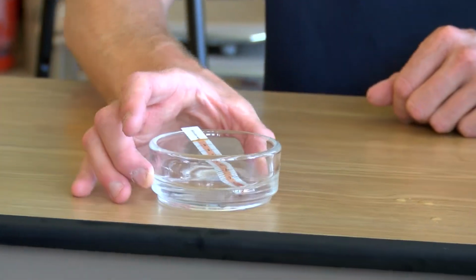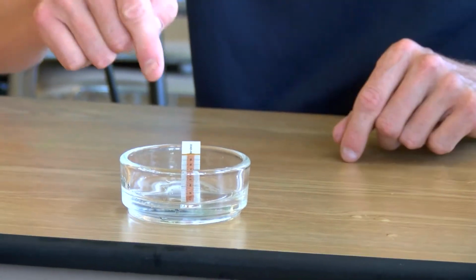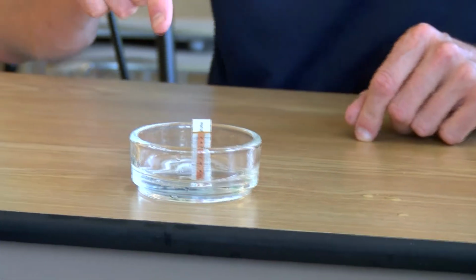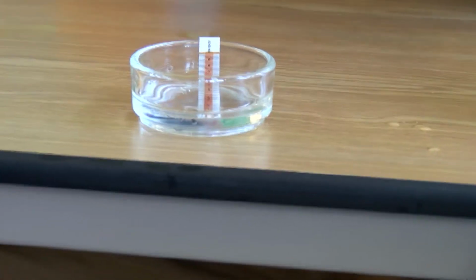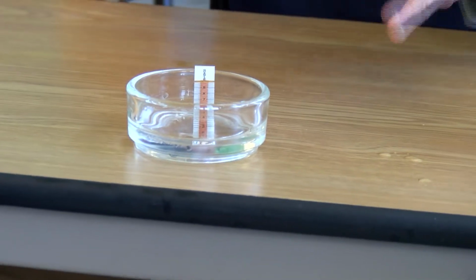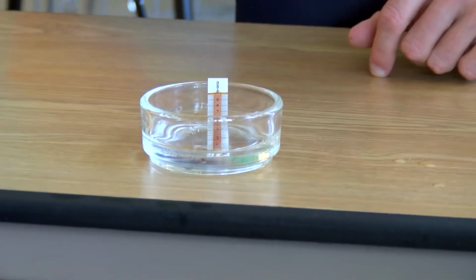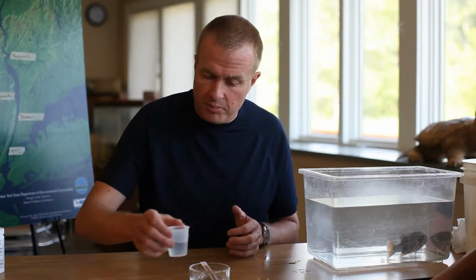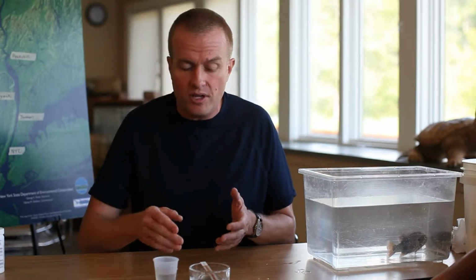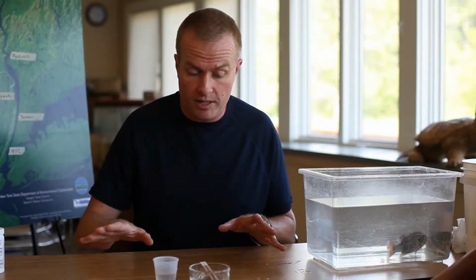Beautiful. Now what we're going to do is we're going to wait. And while we wait, what we're going to notice is at the bottom of that scale, there's going to be a little white triangle start to develop. We're just going to let that little white triangle do its thing until this yellow strip at the top here turns dark, dark brown. It may take a few minutes, so we'll just set this up. And if you don't have a petri dish, it'd be fine to use a little plastic cup or anything else as long as the bottom is in the water, but the top is completely dry.